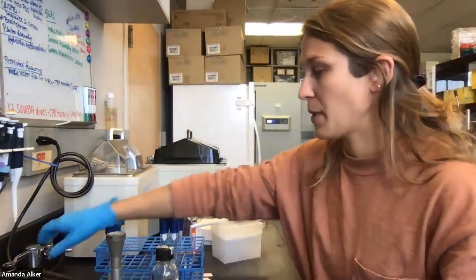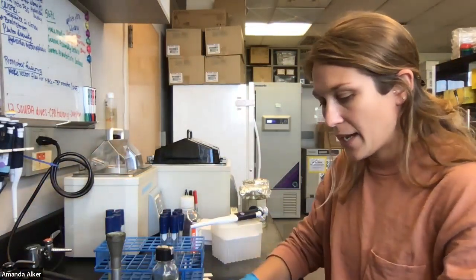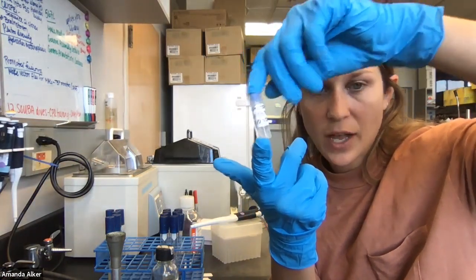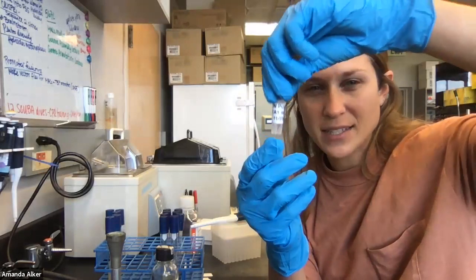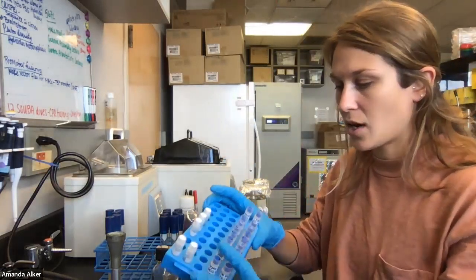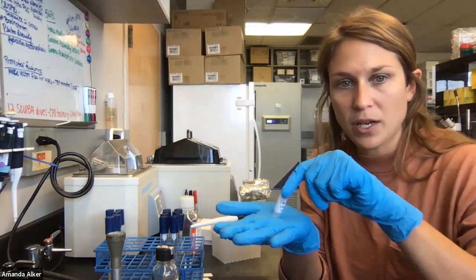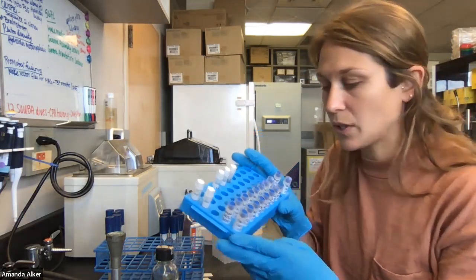As always, my bench is clean and gas is on. We store these cultures in little tubes that are 2 mL tubes called cryo vials. They allow us to store them at really cool temperatures — they have a threading that doesn't freeze, so it makes it a little bit easier with a gasket on there. One thing is that we use these fancier rack holders for them because the bottoms don't fit really well. They are self-standing but a little unstable because they're top heavy, so having them in a rack like this is really helpful.